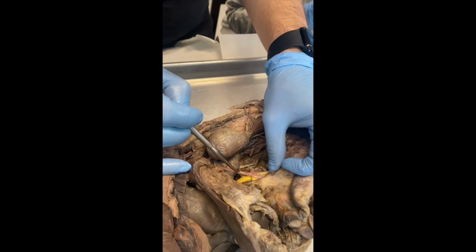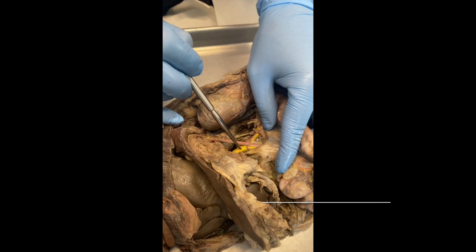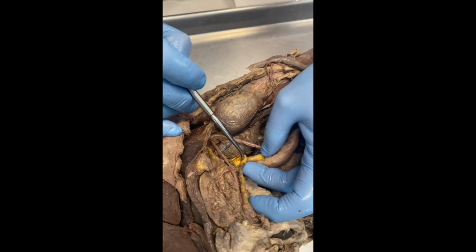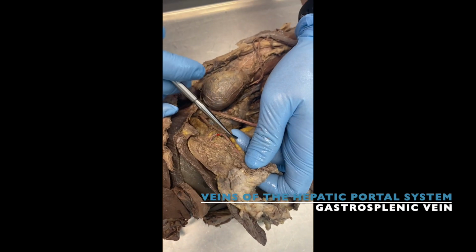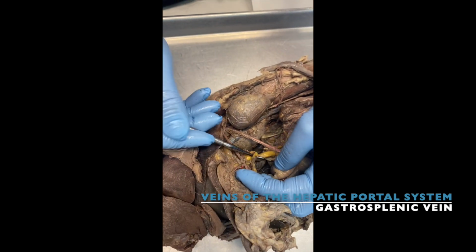If this is your superior mesenteric artery, guess what's the name of this one? Big one. Very good. Then, guess what's the name of this one that's coming from your two regions? One is coming from your spleen, and the other one is coming from your stomach. Guess what's the name of this one?